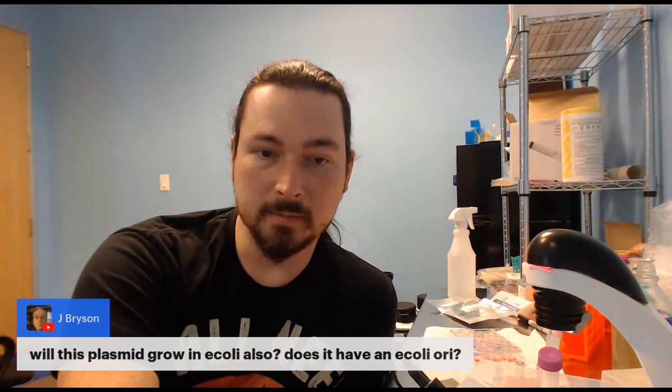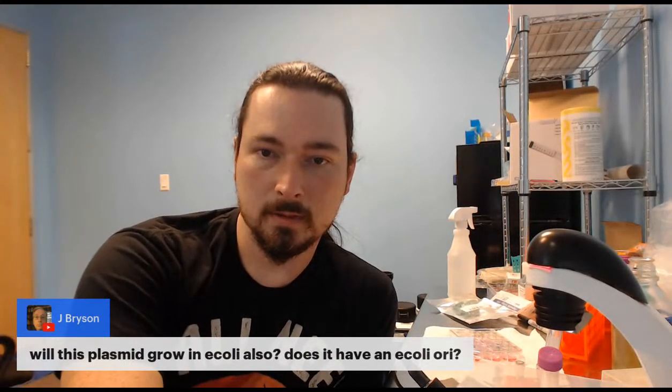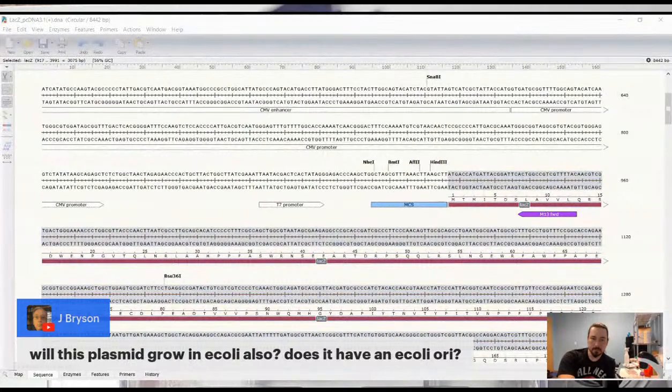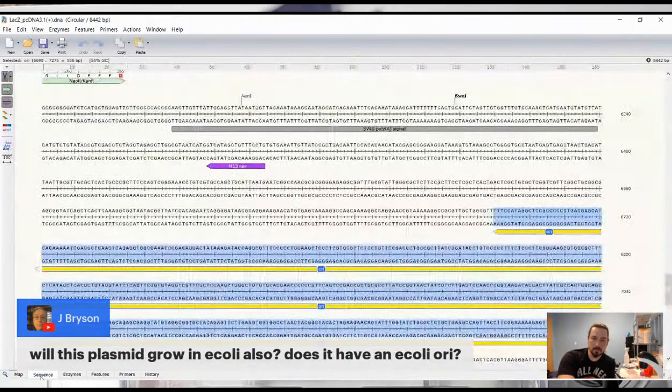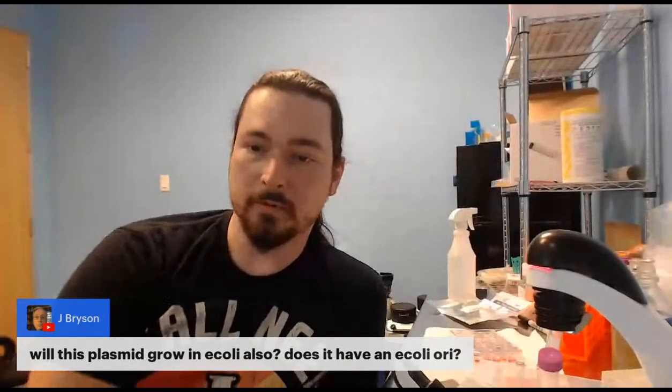So yes, this plasmid does have an E. coli origin of replication. Let me show it to you. The plasmid sequence should be in the classroom. Let me make sure this is popped up over here. Okay, the map. So that is our E. coli origin of replication. That means we can take this plasmid and grow it in E. coli, and then make more of it if you wanted to make more of it.